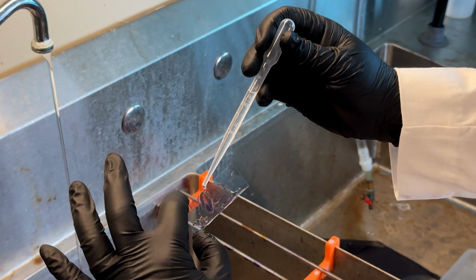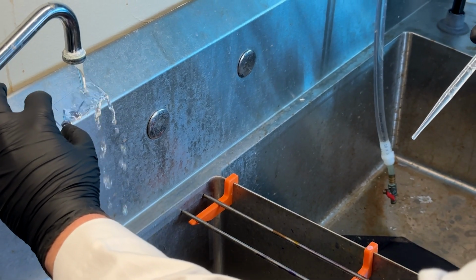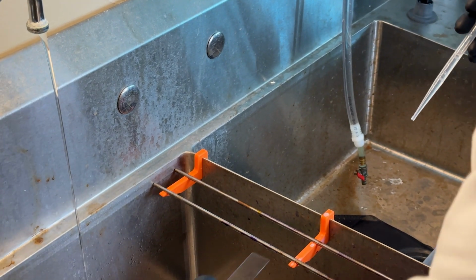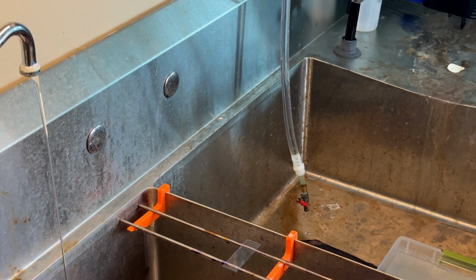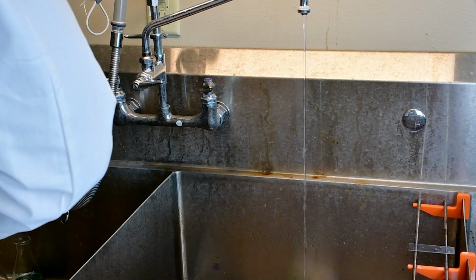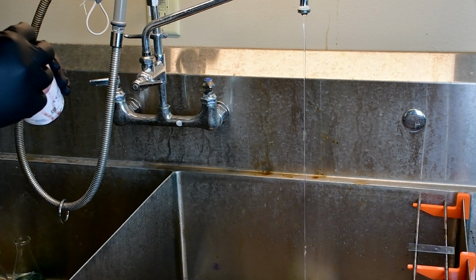So I'm going to add a little bit to the top. I'm watching carefully, and I'm done. And it's going to happen very quick like that. It's going to be very tricky at first. It's going to take a lot of repetitions. Once you get a sense for it, it's quite simple. And one thing to keep in mind is that I don't need the full slide to be perfect. Really, what I'm looking for is at least some portion of that slide is good, because ultimately, when I'm looking at it under the microscope, I'm looking at such a small frame of view that I'm not going to see parts that I have maybe over-decolorized or under-decolorized.